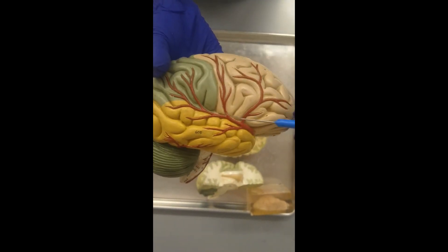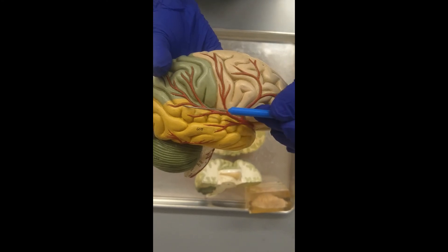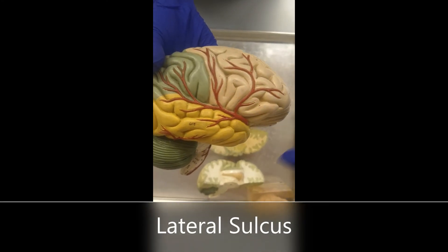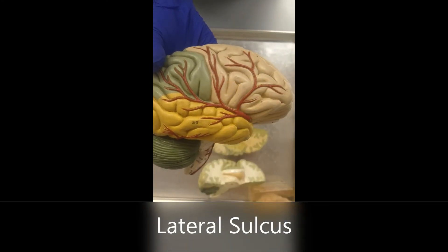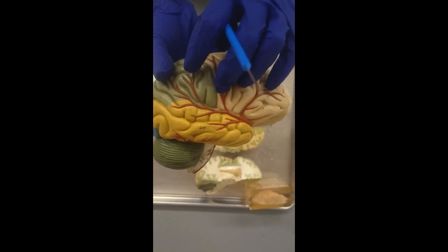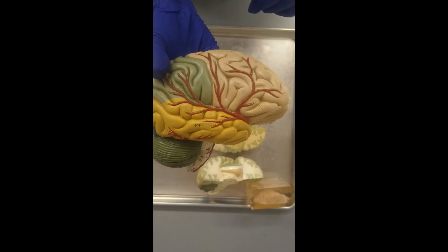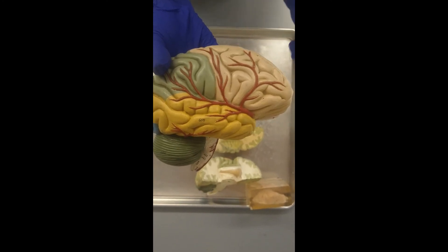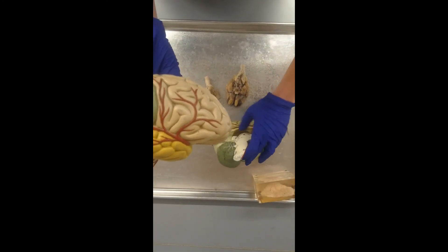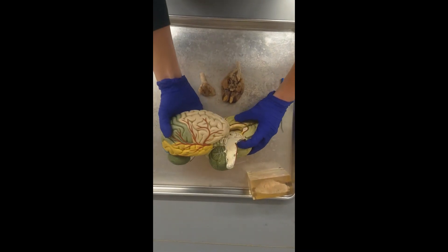I also want you to be familiar with the lateral sulcus. The lateral sulcus is going to be dividing the temporal lobe from the frontal and parietal lobe. So we've done a lot of the external structures of the cerebrum.